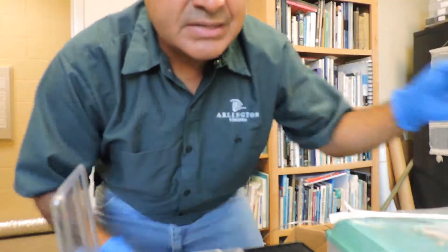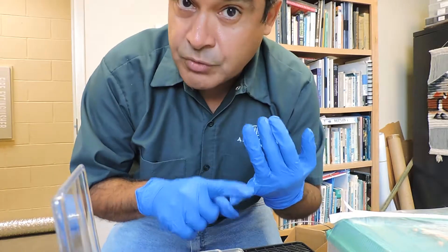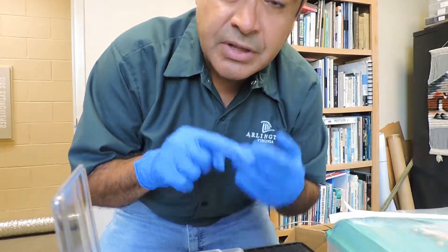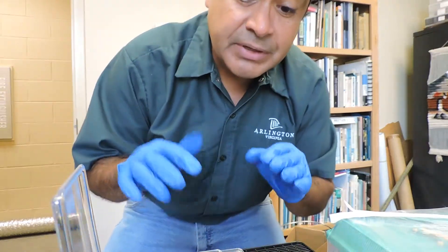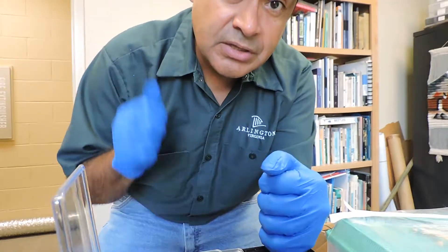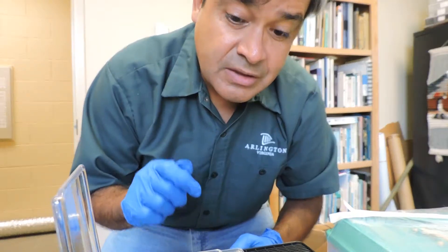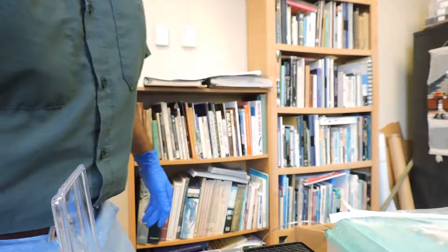This cardboard will keep it safe, with instructions that it's a newly metamorphosed wood frog froglet and that we need to test one sample for chytrid. I'm repeating the exact same process for ranavirus. Once we get a clean bill of health, we can take all of these guys in and hopefully start a new colony with a clear conscience that we haven't introduced any of these infections.